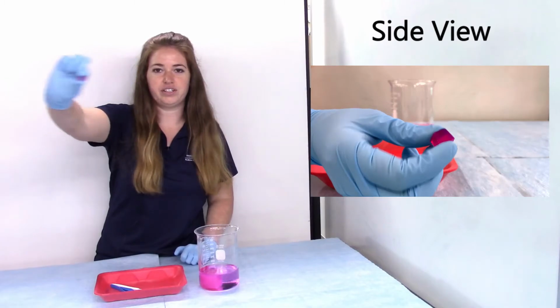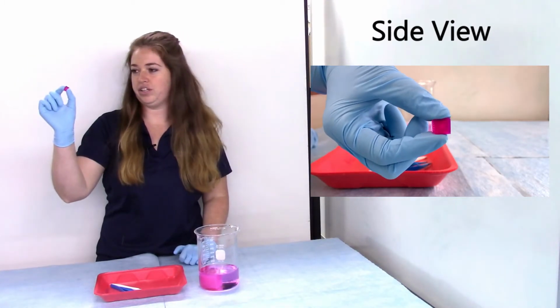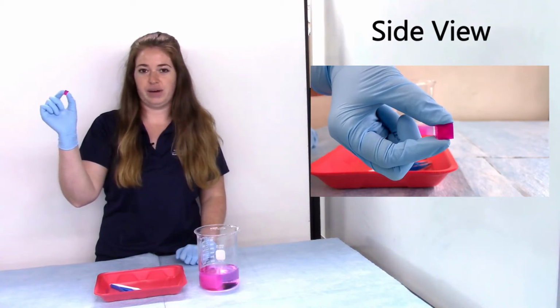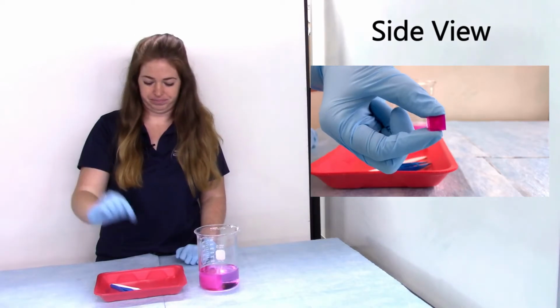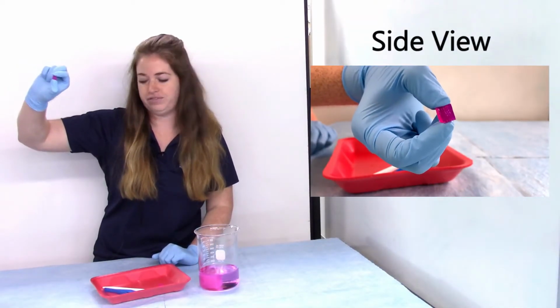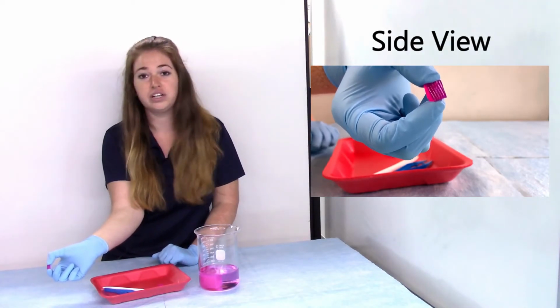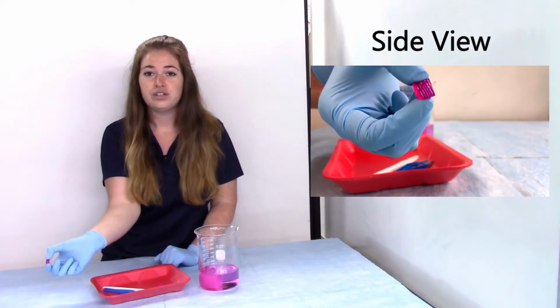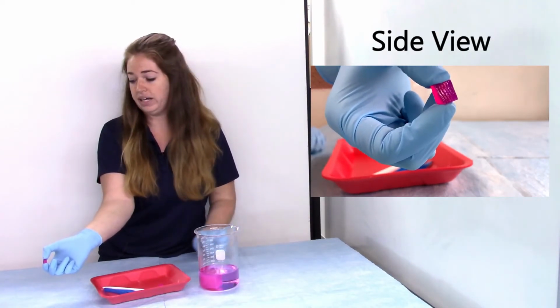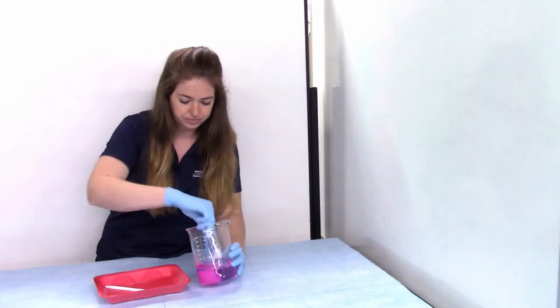So here we have our smallest cube. What we want to do with our cubes is cut them in a cross section so that we can see the inside as well. Alright, so I just cut our cube in half, and you can see that the inside has turned completely pink as well. So what that means is our sodium hydroxide has diffused all the way through our smallest cube because the entire thing has turned pink.